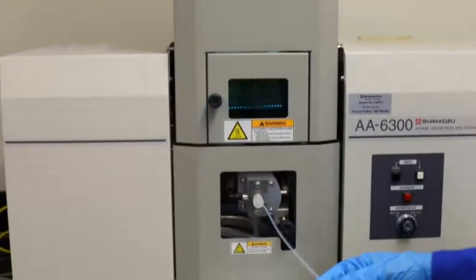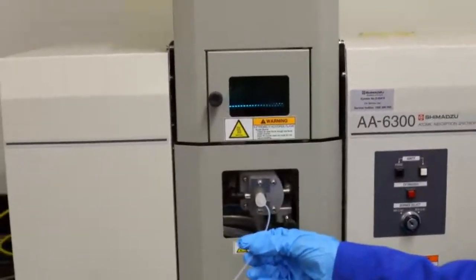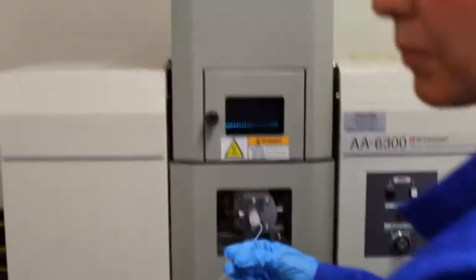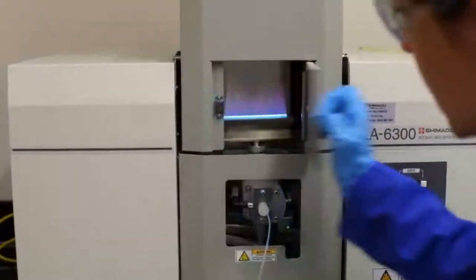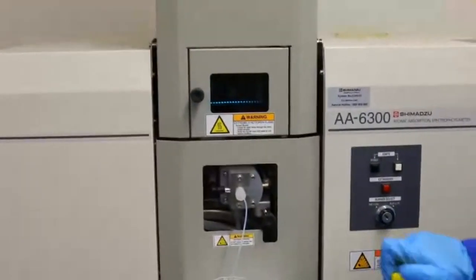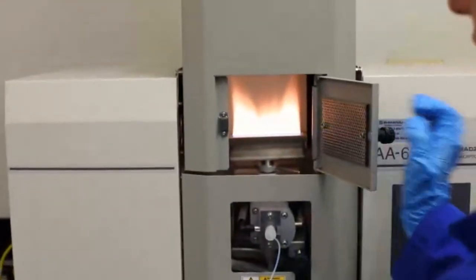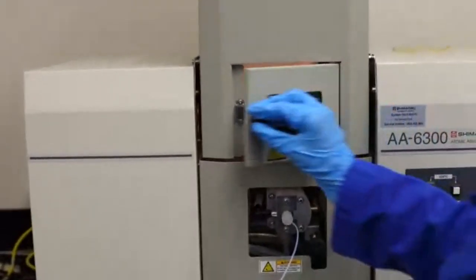Okay. And ET's just coming back with some water for us. Thanks, ET. We need to make sure we don't use tap water because if we use tap water, there are things still in there. There we go, it's cleaning up beautifully now. All right, so now we're going to go on to our cobalt. This one gets a bit of a funky colour. It's sort of a bit like an apricot-y colour. Very nice.